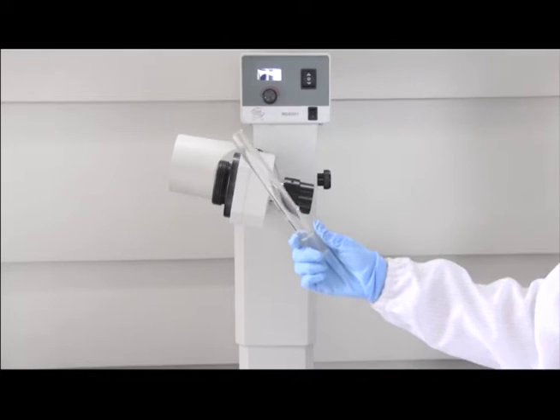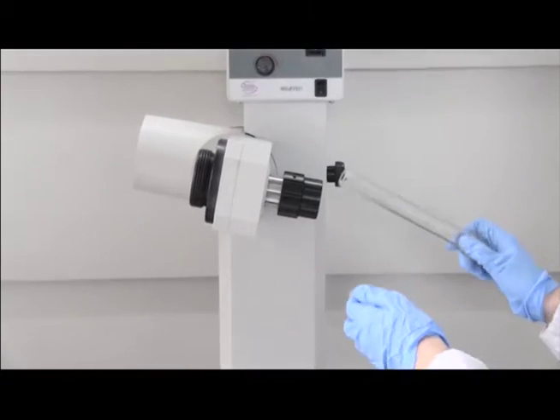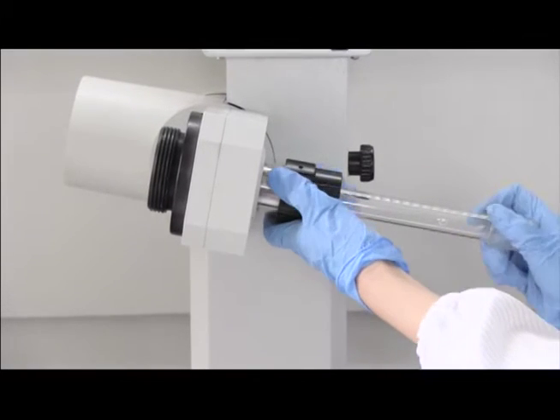First install the single piece vapor duct. The vapor duct has two locking dimples. Slide the vapor duct in until it cannot be inserted any further.